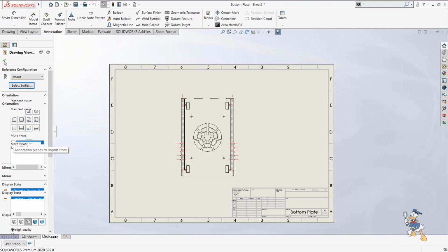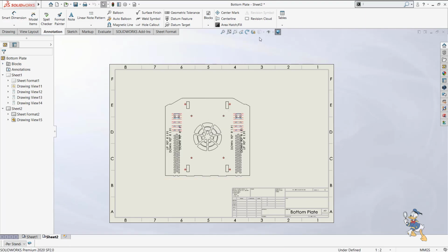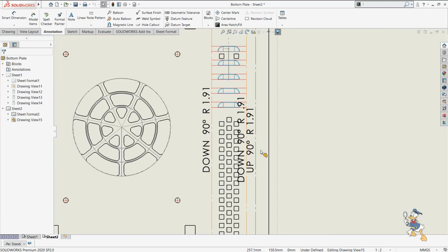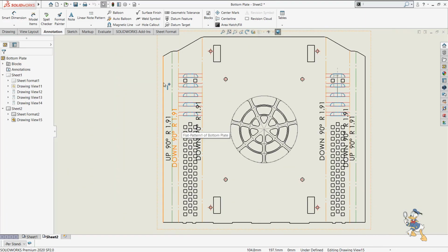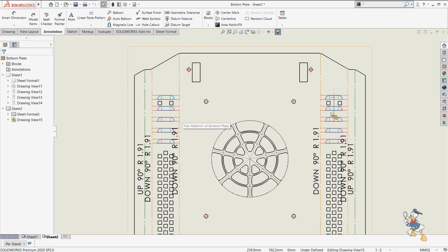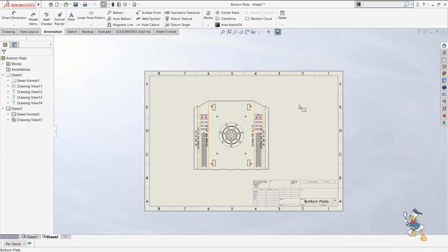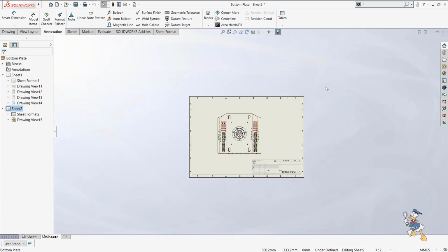And after checking it, it generates the flat pattern on this. It will take some seconds to generate this flat pattern view for this body, because it is generating automatically, so it takes time. Sometimes it depends on your PC, its configuration and the heating factor of it. And we can select this kind of template, so that's why it is showing the upfront bend in a green line, and in an orange line it is showing that we need to bend this part in the down direction. So this kind of feature is available in SolidWorks for generating drawings of sheet metal components.